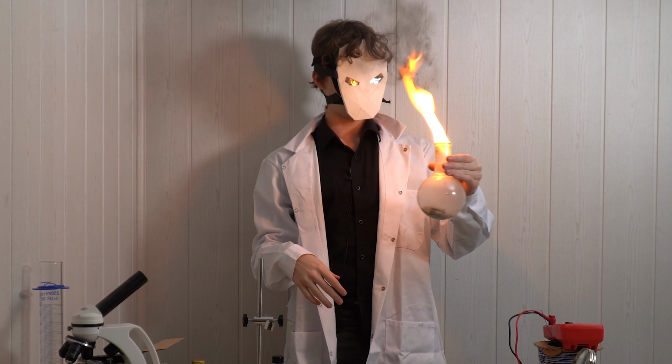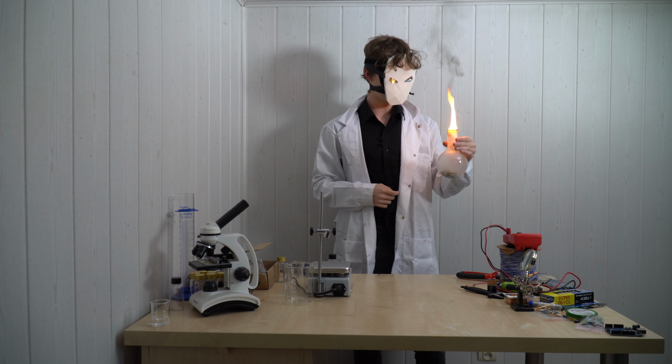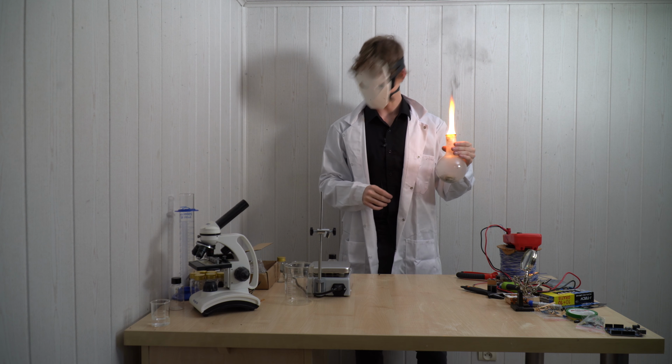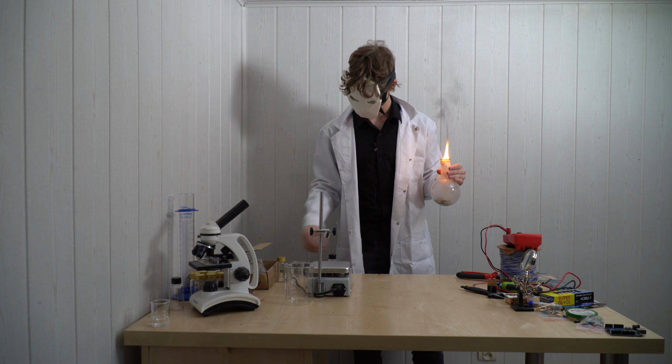Now, that is fire. It's, you know, not good. You should not have fire indoors, so we should put it out. How are we going to do it? Am I right? That's fire. That's suboptimal. Well, we can do it really easily.